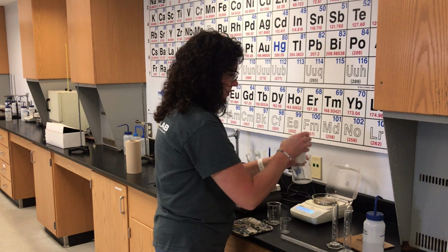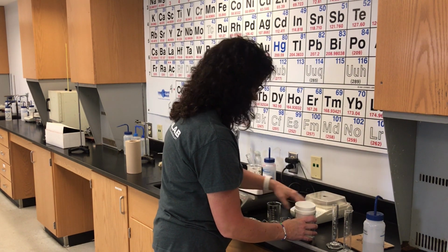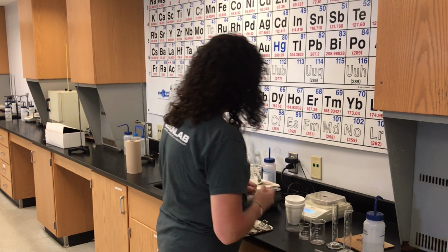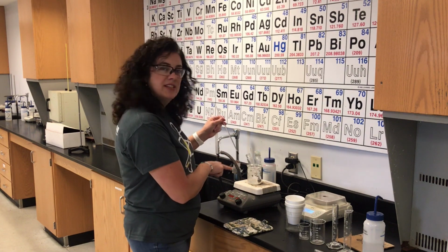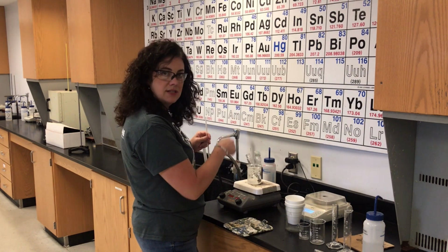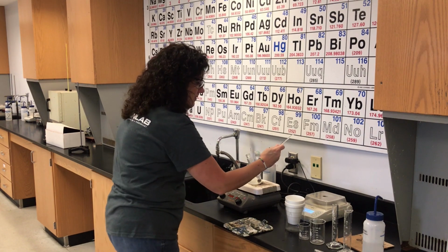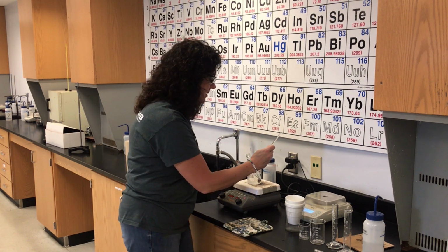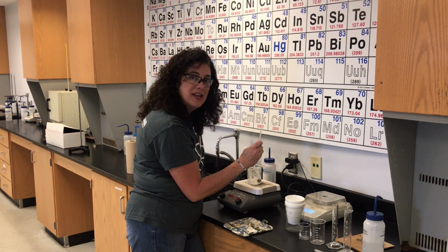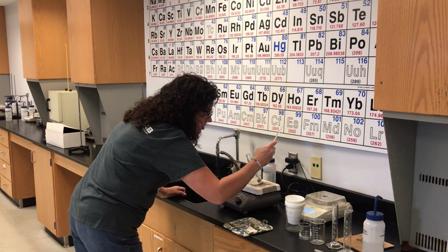Now I'm going to have my calorimeter in my beaker for stability. I'll zero the balance, because you always want to leave the balance zeroed out. I'm going to measure the temperature of this water. It should be 100. But the temperature of this water, y'all, is the temperature of the metal, so I'm going to double check that. Even though we know water boils at 100 degrees Celsius, depending on how a thermometer is calibrated, it might measure it as 99 or 98 or 101 or whatever. So we're just going to be sure.